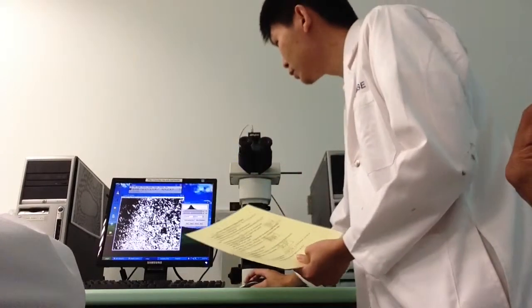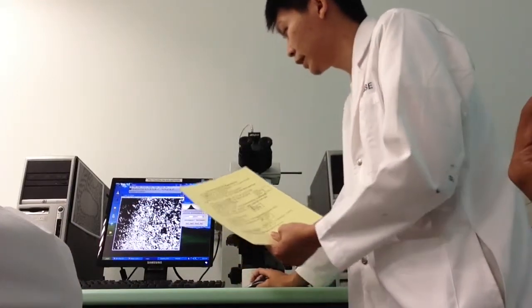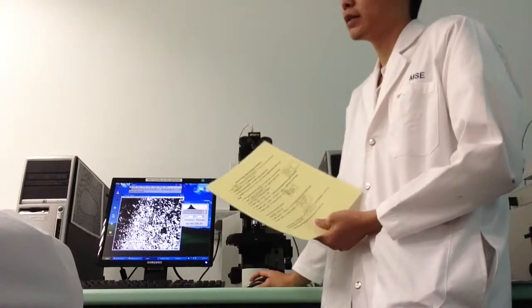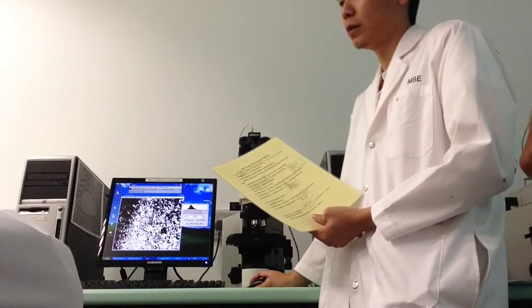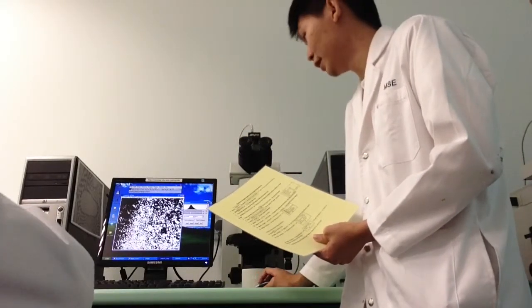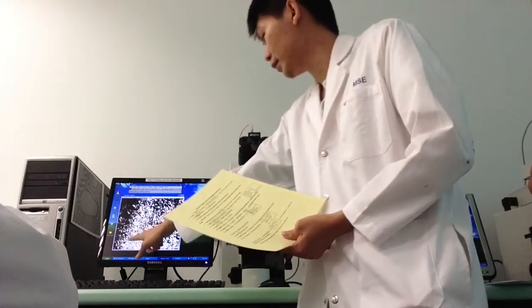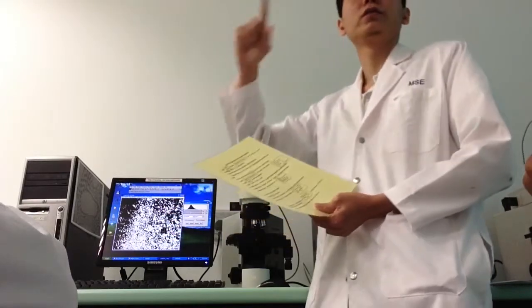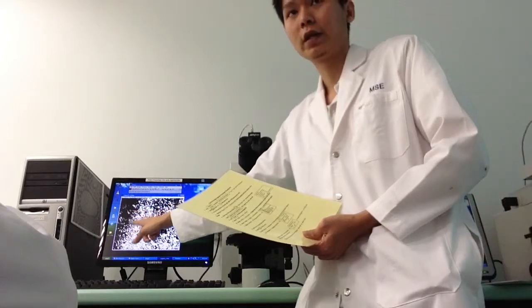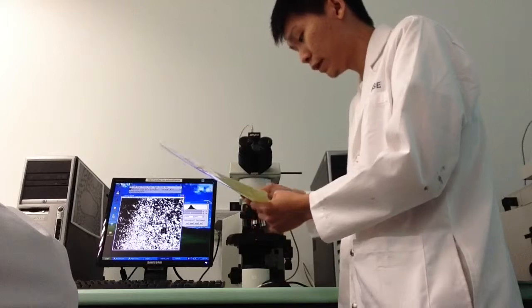You choose the first icon, which is already selected. This is to select your area. There's no restriction as to how big or how small your area will be. If you are happy with any area, then it's okay. So you just drag your mouse. I'm not sure if you can see over there, there's a yellow box over here. That is your area.